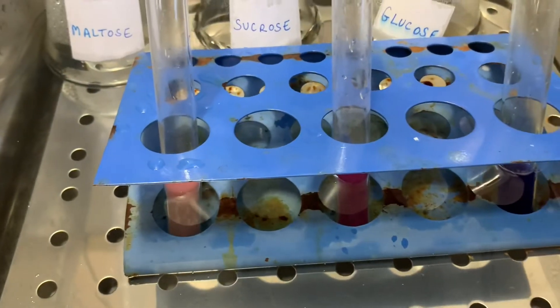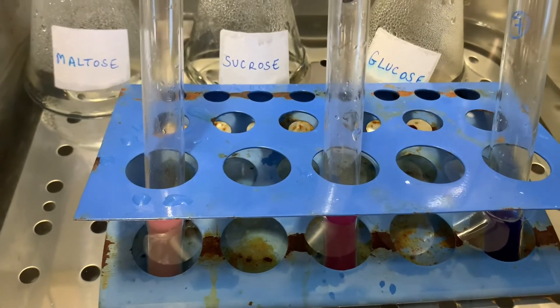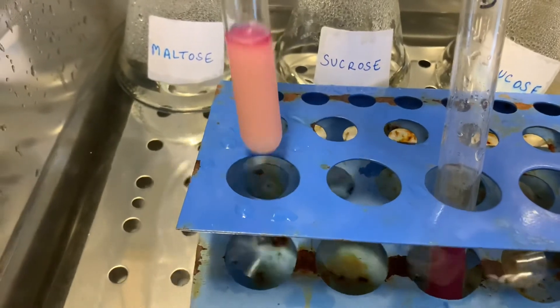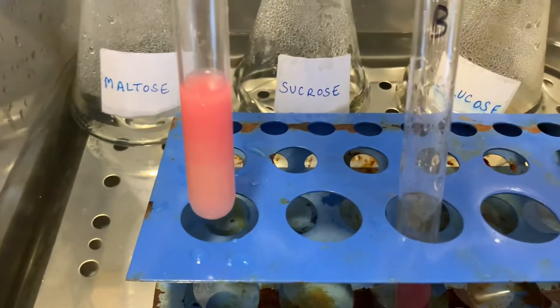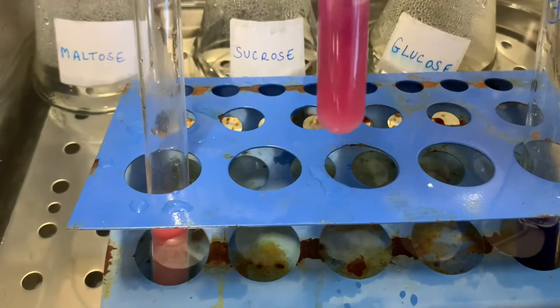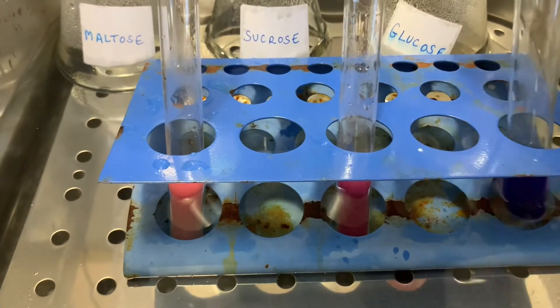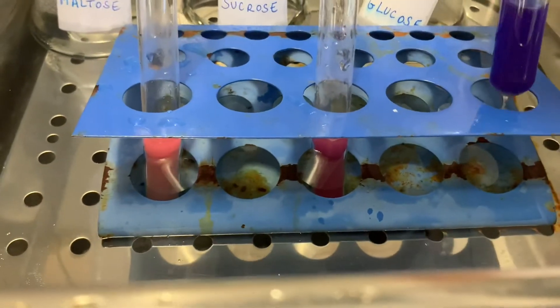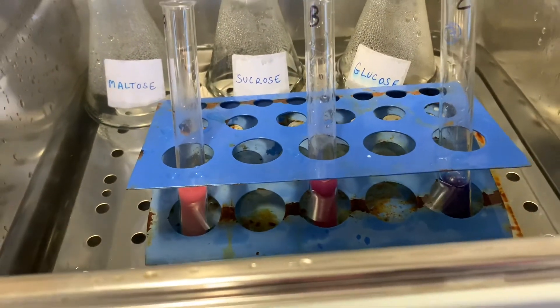At seven and a half minutes you can see quite a significant color change — test tube A is starting to go colorless. There's just a tiny bit of pink color left; it's almost colorless. The live yeast and water tube is still reasonably purple, so some hydrogen is present but nowhere near as much. The boiled yeast and glucose tube has had no change at all and is still very much a blue color.